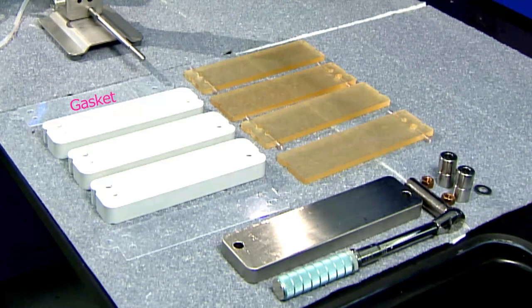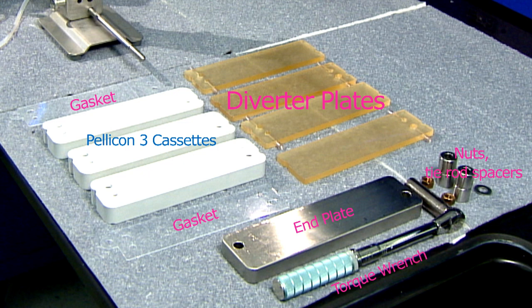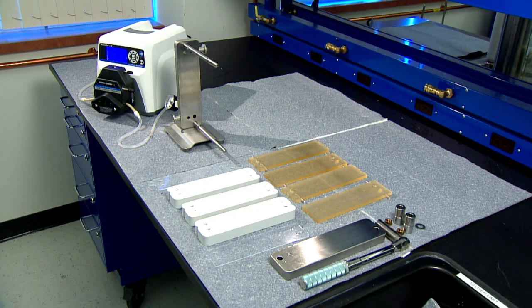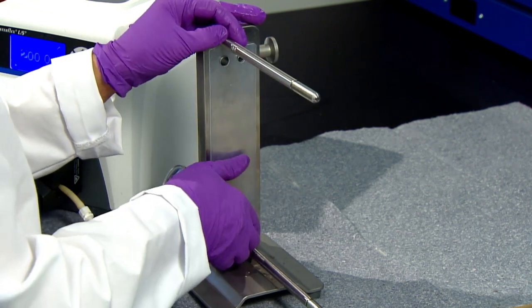A three-section single-pass experiment requires a kit which contains gaskets and diverter plates. In addition, you will need three small format cassettes each of the same size, hardware for your holder and a torque wrench. Always start with a gasket against the end plate to avoid leaks.